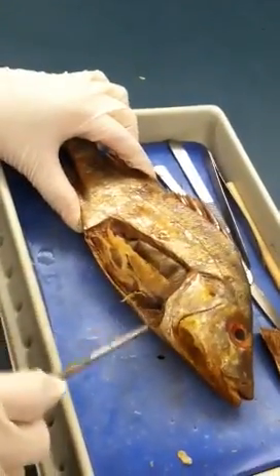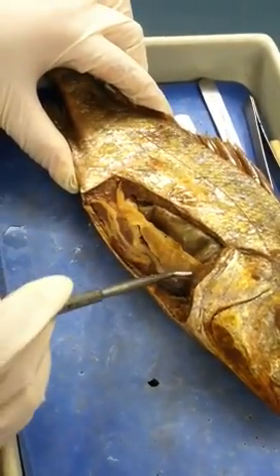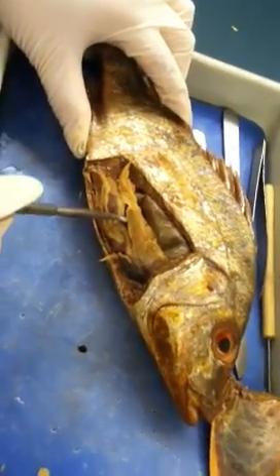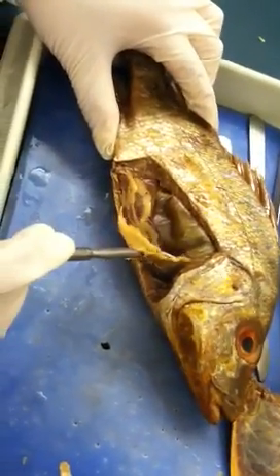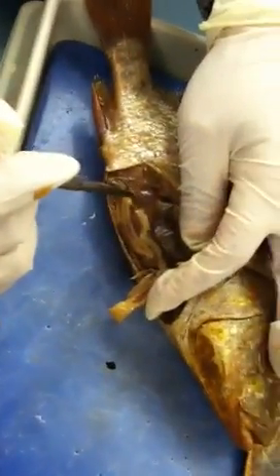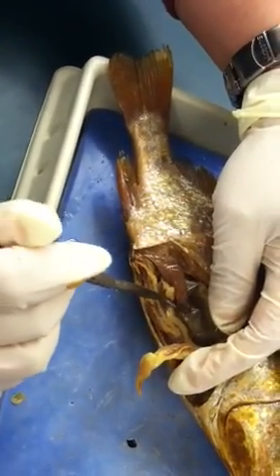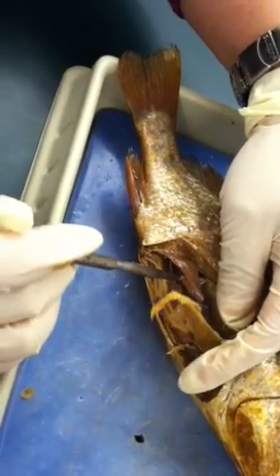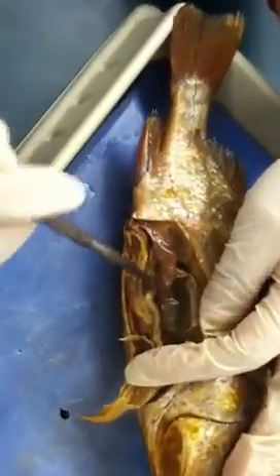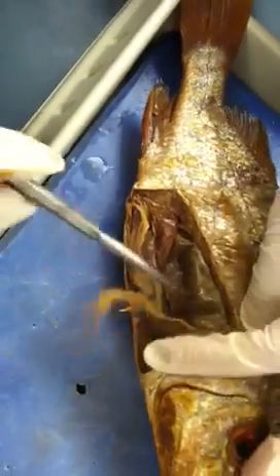And when you get to the internal structure, the first organ you will see is this one. It's originating from the head, and that will be liver — that's usually the first organ you see in the fish. And if you lift the liver a little bit up, you will see another similar structure, but it's originating from the back, and this one has a string attached to it. This one is a gonad. So remember: if the organ is originating from the front, that will be liver; the one from the back with a similar shape, that will be gonad.